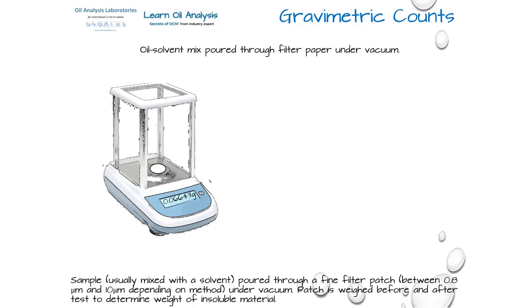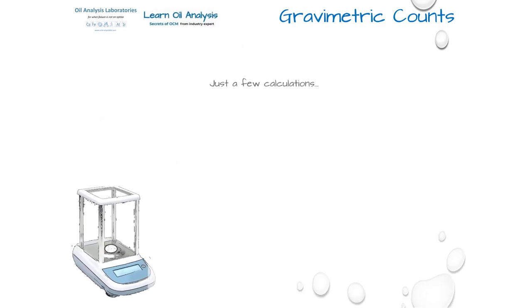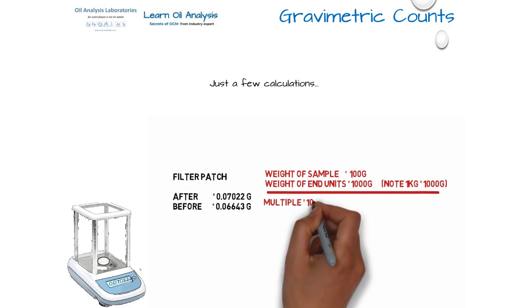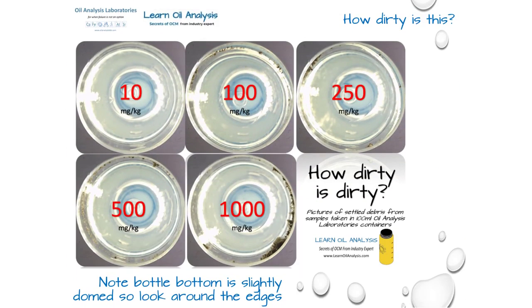First, we weigh a clean filter paper patch, then pass the sample through it under vacuum. Anything larger than the pore size is caught in the patch. We then weigh it again. Doing a few calculations, we then have a weight in milligrams per kilogram. To put in perspective, here are some sample containers that have varying degrees of debris at the bottom. Note you need to look at the edges as the bottle bottom is slightly domed.